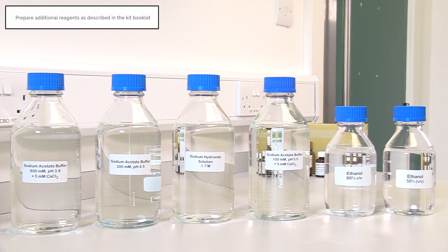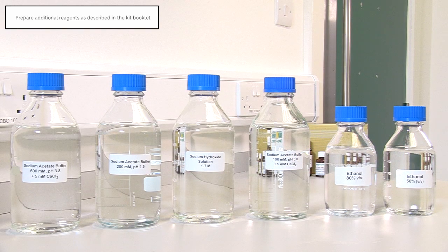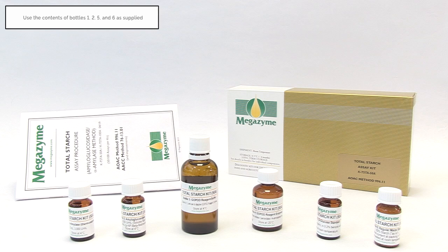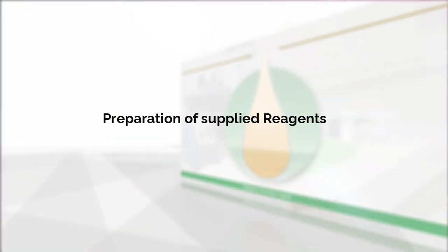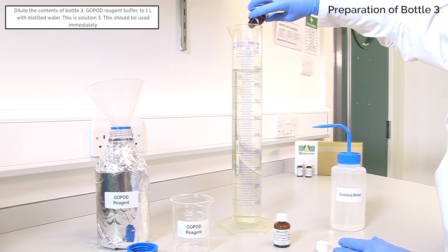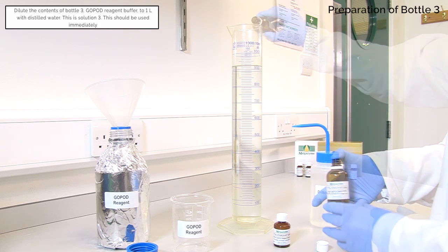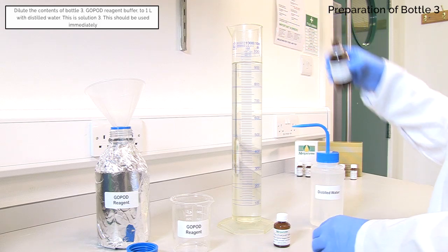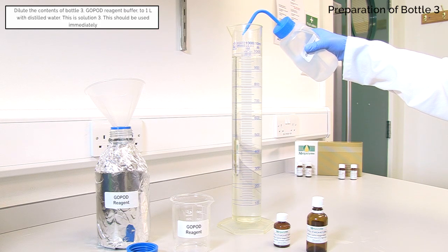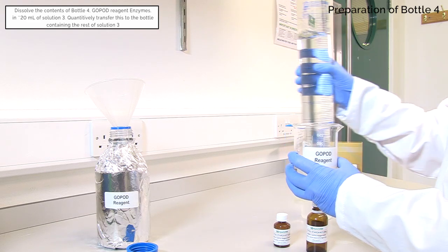Prior to sample analysis, prepare the required additional reagents as described in the kit data booklet. When all of the additional reagents have been made, the kit components should be subsequently prepared ready for use. Use the contents of bottles 1, 2, 5 and 6 as supplied. Dilute the contents of bottle 3 GOPOD reagent buffer to 1 litre with distilled water. This is solution 3 and should be used immediately.